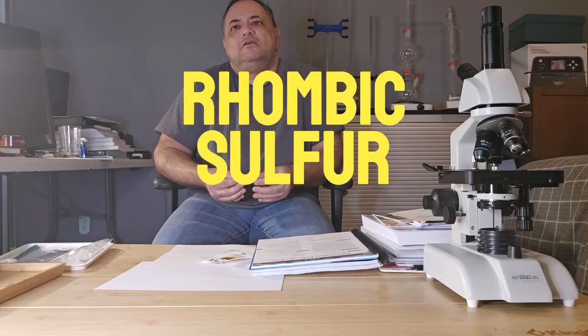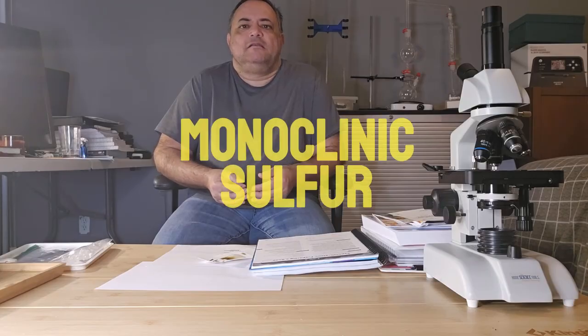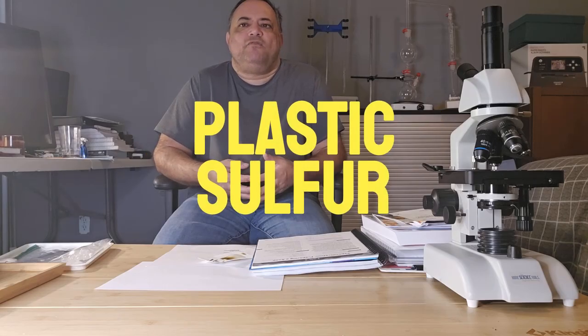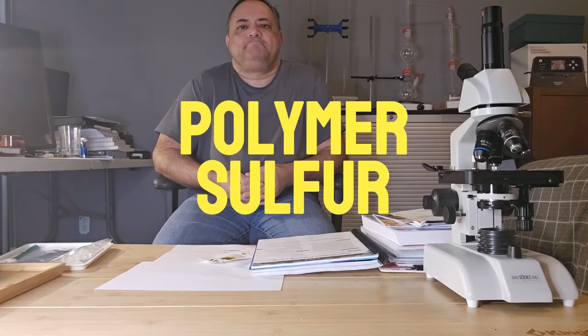The most common allotropes of sulfur include rhombic sulfur or alpha sulfur, monoclinic sulfur, known as beta sulfur, plastic sulfur, or amorphous sulfur, and then there's polymer sulfur. We're going to look at 2 forms of allotropes of sulfur in today's experiment. Let's go outside and get started.